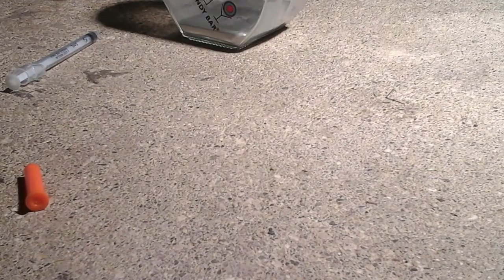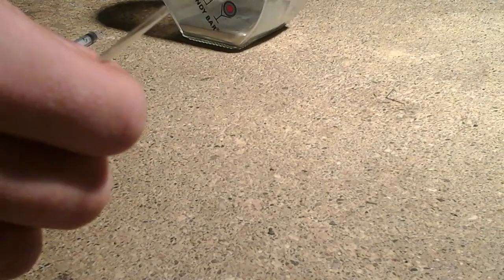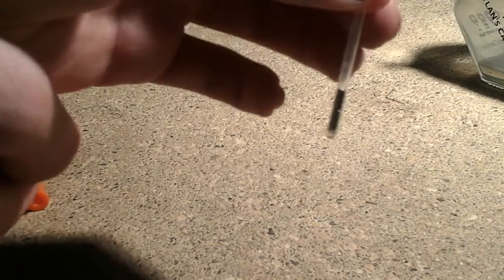I'm sorry I didn't really talk — I was trying to focus. Now that I got that down, look at that: sealed mercury. Now that I have my pure mercury all set up, I'm going to turn on my torch. I'm sorry if you didn't see any of that. I just filled the tube up and shook it around a little bit to get the mercury to the bottom because the tube is so small.